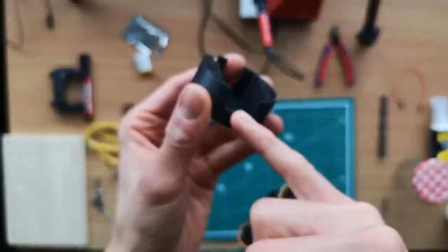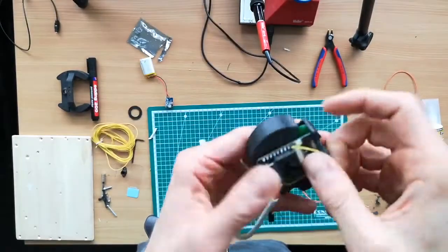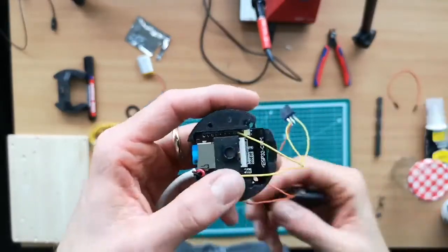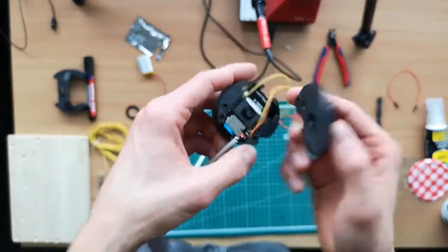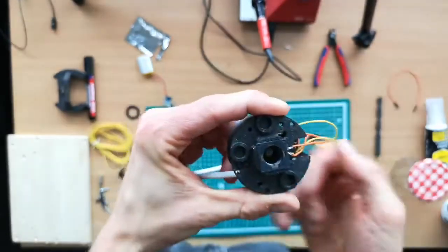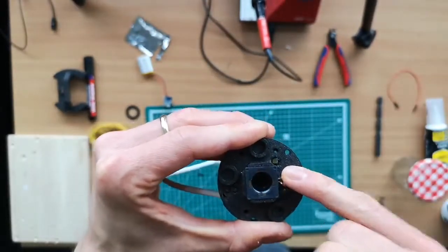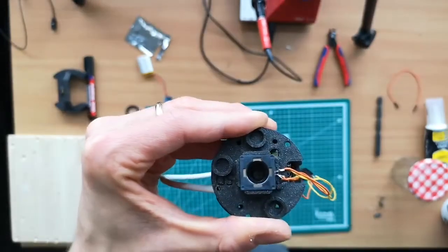Make sure that this bit here is coming for the SD card. So you sneak that in, and then make sure that the wires are finding their proper way. Then this camera here moves into this hole here, so make sure that you align this properly. The SD card bit here should also be oriented so that the SD card is right there. Make sure that the wires are not hitting the LED, which is right here, because then it's getting blocked and we cannot use it for our illumination. So this is almost it.